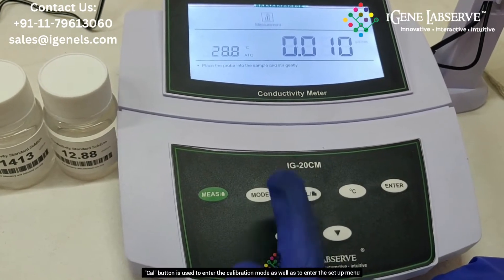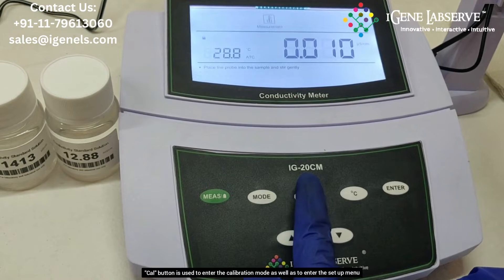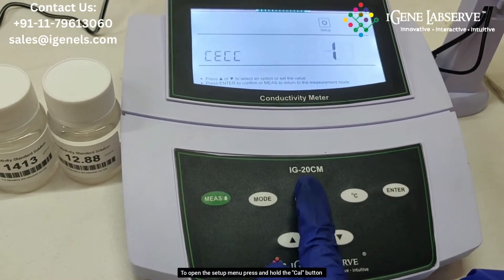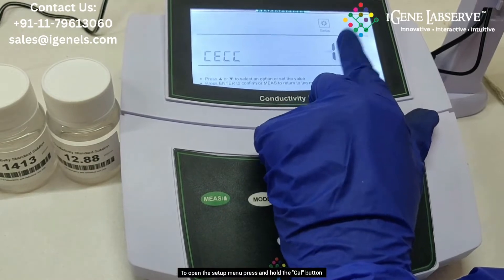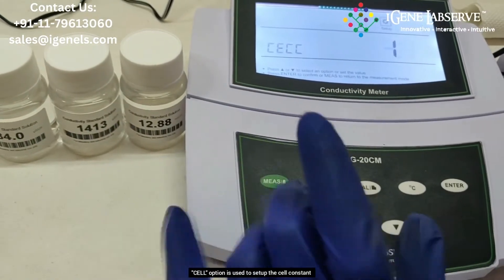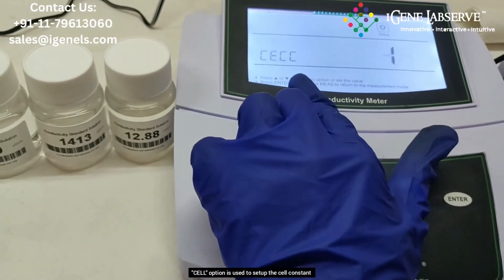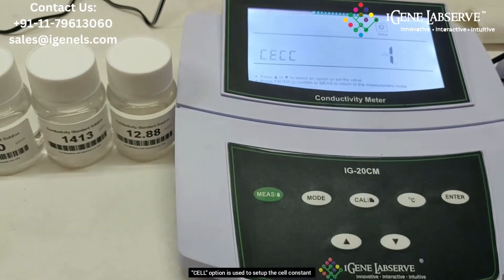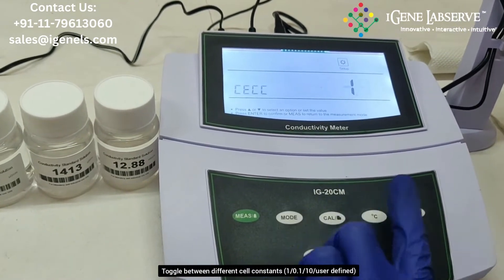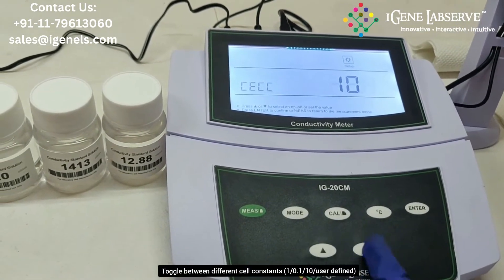This is the cal button. To open the setup menu, press and hold the cal button and the setup menu opens. The first parameter is the cell constant — you have to set the cell constant according to the conductivity electrode that you are using, using the up and down arrow keys.